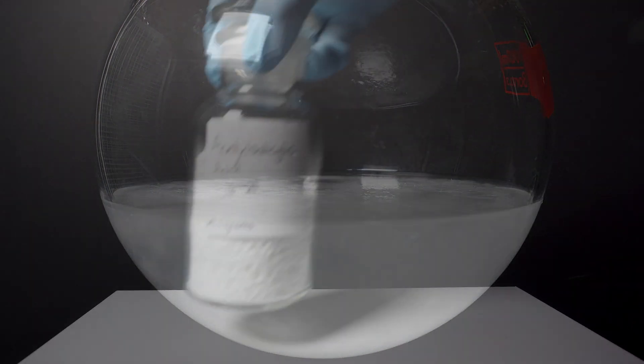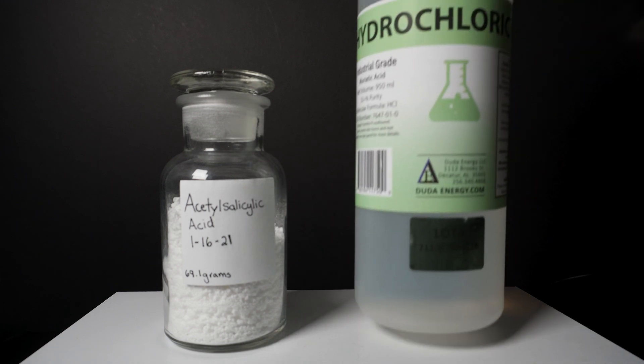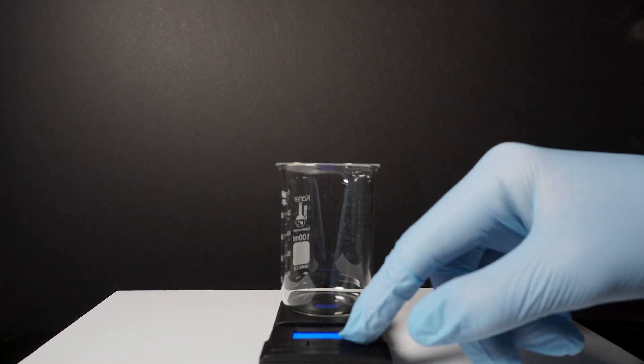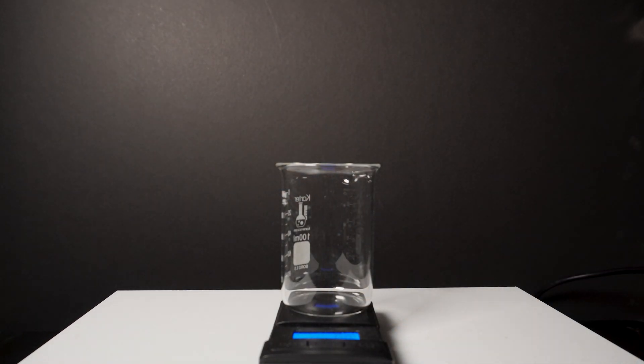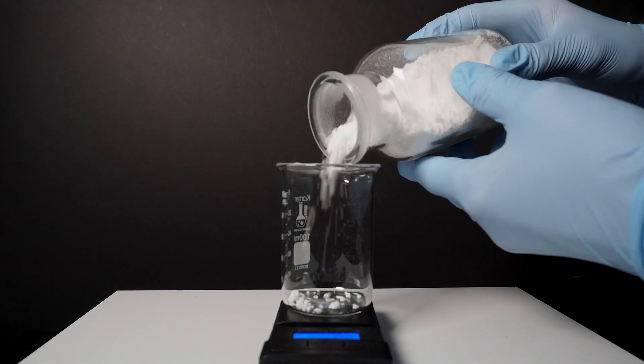The only materials that I will need for this video are the acetylsalicylic acid I extracted last video and hydrochloric acid at 31.45%. I bought my hydrochloric acid from Amazon though you could easily get it locally at a pool store or a hardware store.